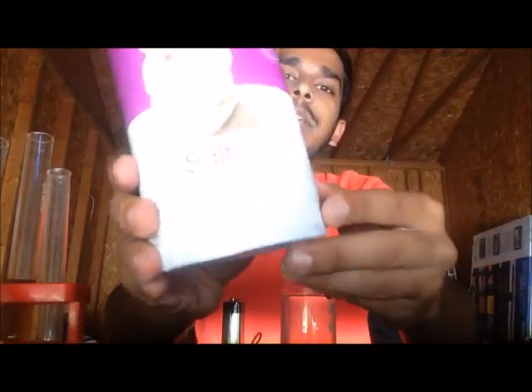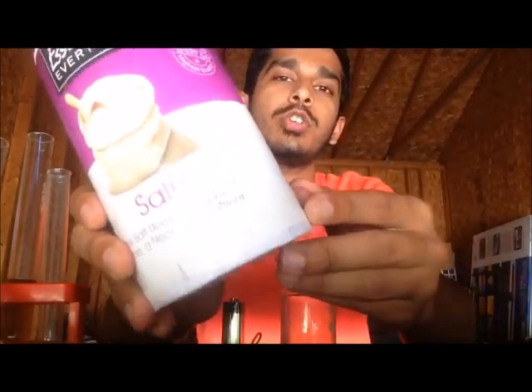This is not the same as the iodized table salt you normally use. The reason I don't want iodized salt is because it has other ions besides sodium and chloride—it would have iodide, potassium, and can also have calcium from anti-caking agents. I don't want those impurities to interfere in this reaction.